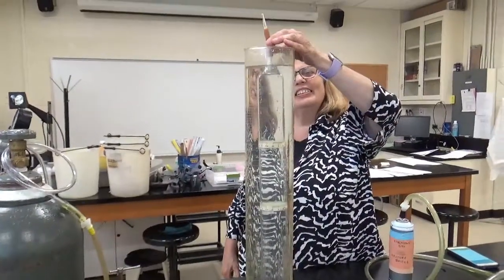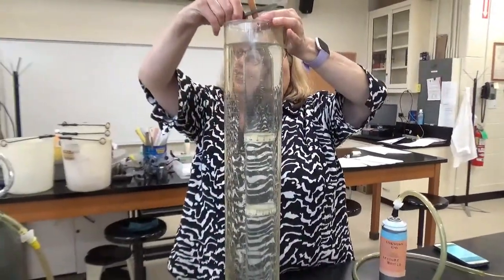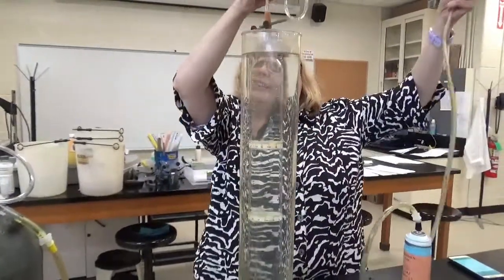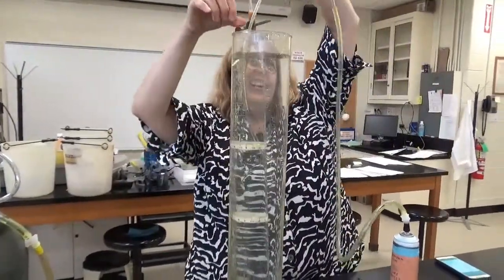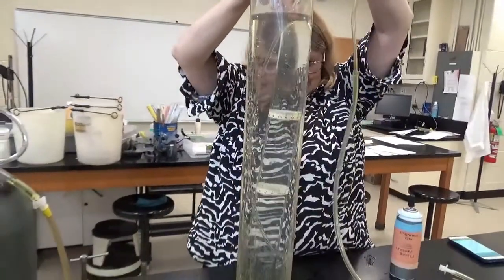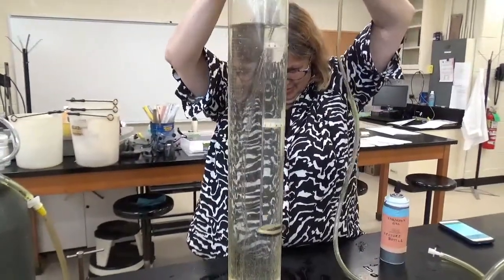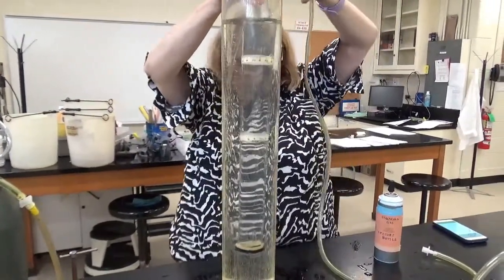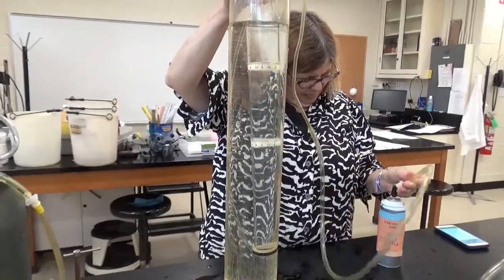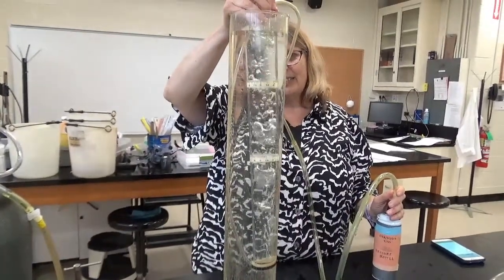Okay, now we're going to use the unknown gas again. The first time we had a little mishap, so this time it'll hopefully be better. Perfect. You almost need an assistant to do this one. Need 2 hands here. 3 hands.